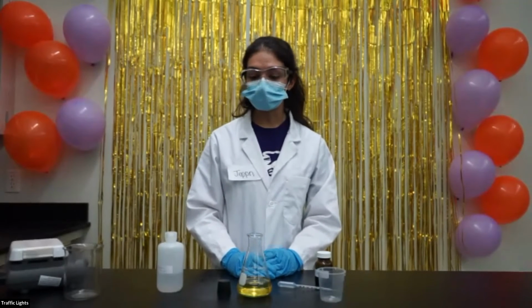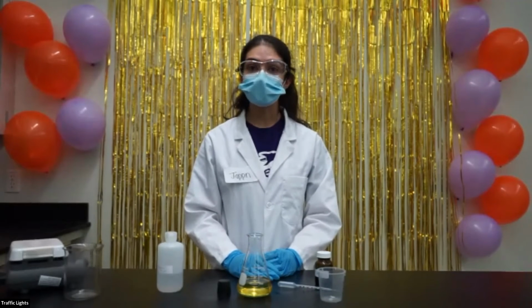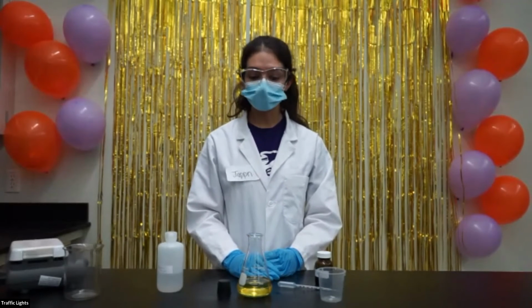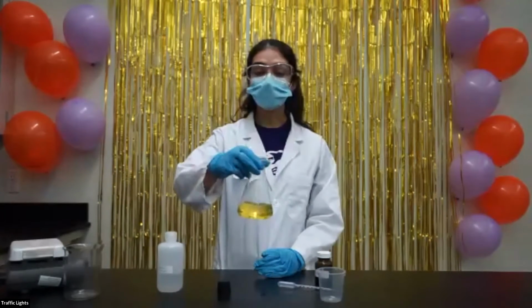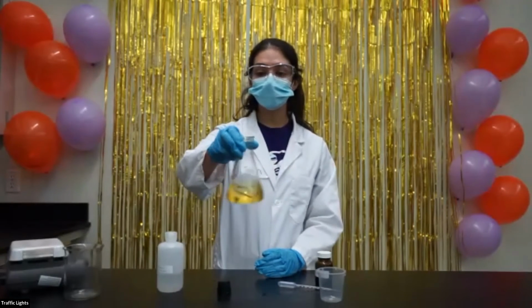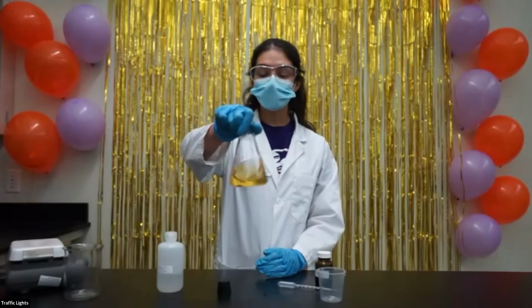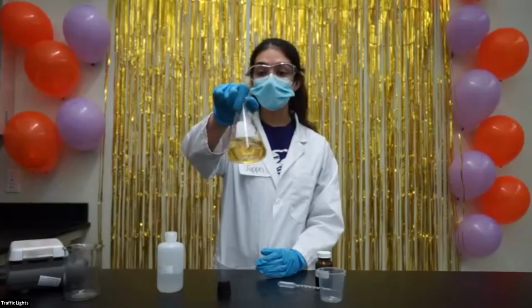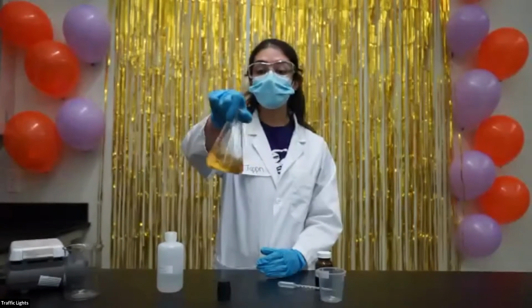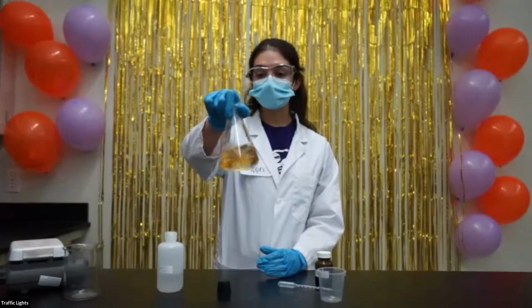Then when we added in glucose, glucose is a sugar and it reduces indigo carmine. So indigo carmine became the yellow color. Now, when I lightly swirl the flask, it turns red. And you can see traces of red in it. And this is because in the air, we have oxygen. And oxygen oxidizes the indigo carmine, so you see that color change.